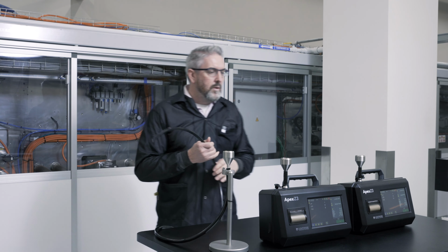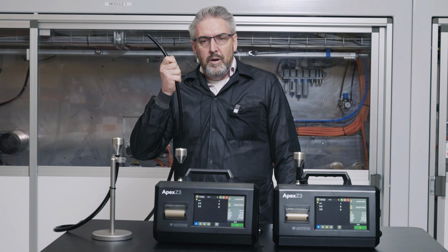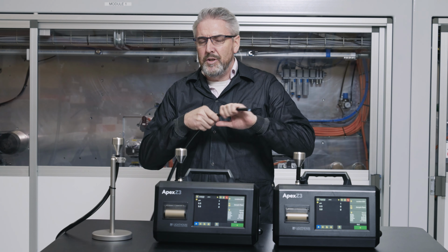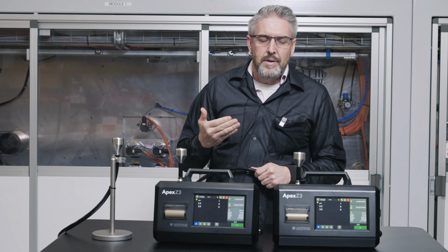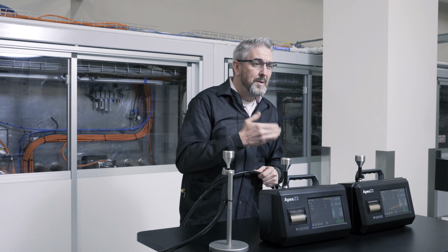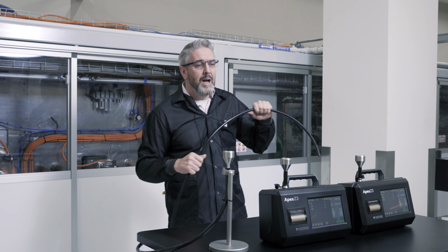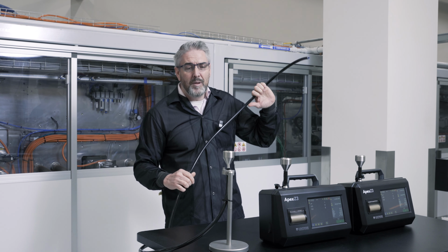So what we're going to do is have a system set up where we have the unit with the sample tubing, with the 10 feet of tubing, with at least 4 bends. We're exceeding the ISO TR 14644-21 recommendation, which means you have to validate. So we're over a certain length of tubing, and we have over 3 bends in the sample system.